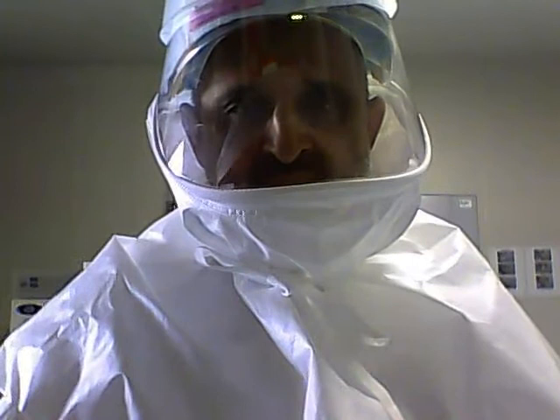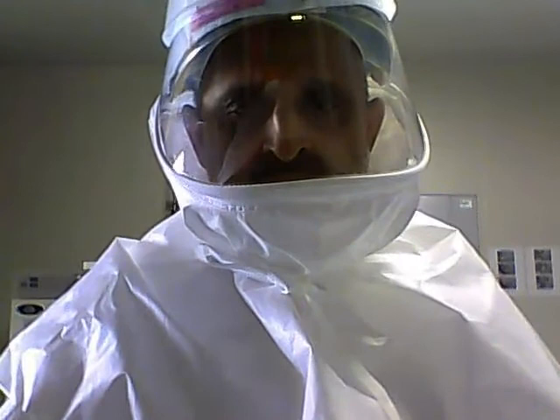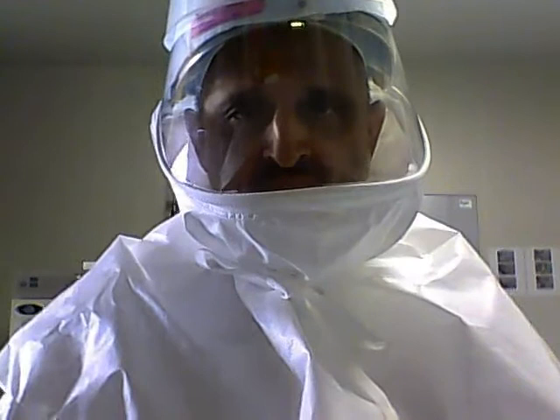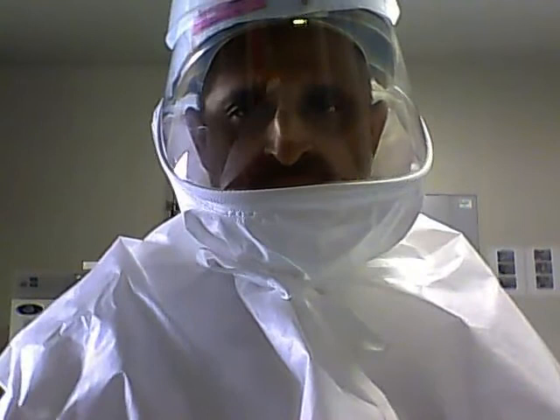You must assess the risk of the procedure itself. We have a risk assessment: we assess the risk posed by the biological agent, and in the case of a sample from hospital patients we assume the highest risk. We then apply the specific controls. In this case, working in a biosafety level 3 laboratory, I am applying the pertinent engineering controls as well as the personal protective equipment I am wearing. These are key points to consider when managing biological agents derived from known as well as unknown samples.